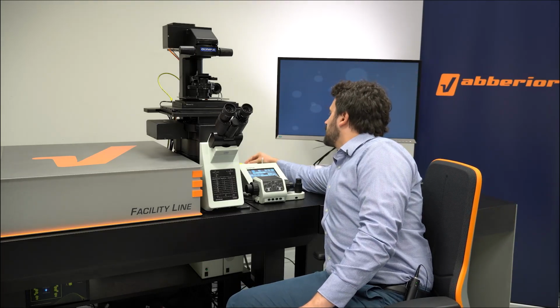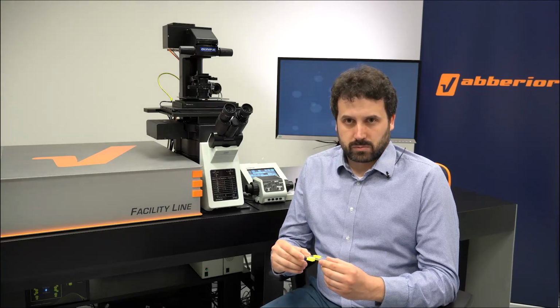And regarding this topic, I have a related question for Gero. Gero, you used an inverted microscope for your demonstration right now. How did you manage that? Well, I improvised and manufactured a little chamber, which is here, one of the samples. Basically I'm using a normal slide, a normal cover slip, and then I cut a few spacers and also sponges to keep everything together. These sponges have a little slit, they keep it together. They don't squish the leaf down too far to stress it, but yeah, this works. And I had good results with leaves. I can't really speak for other parts of the plants, but for the flat part of a leaf, this worked fine on this inverted setup.